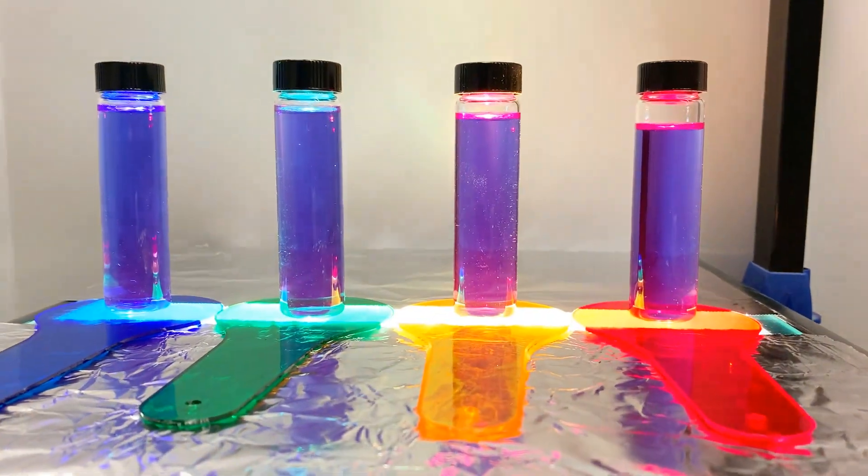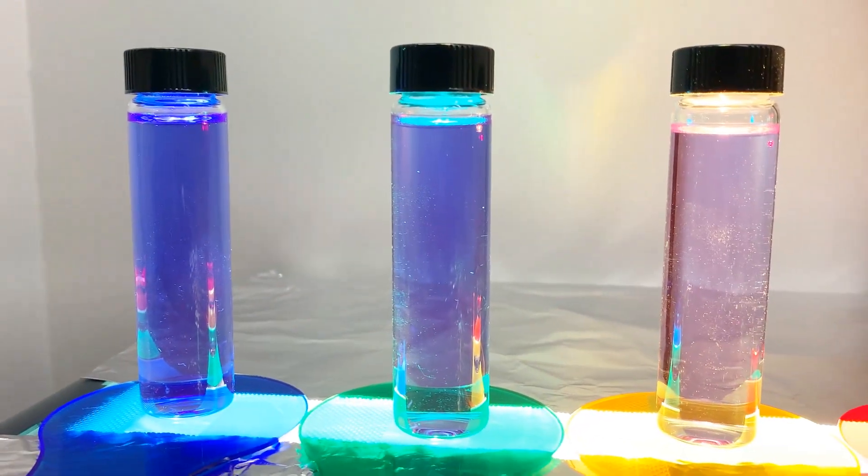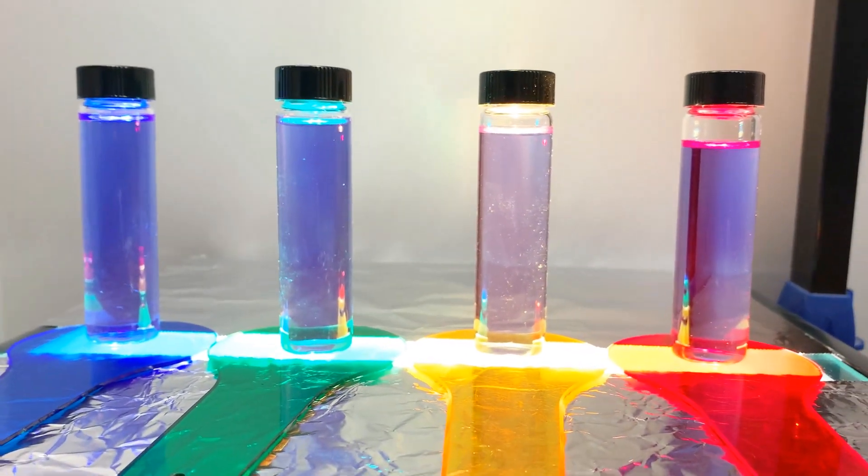Check out what happened when I turned the light on. I don't know about you, but it looks to me like the blue color is fading the most in the vial that has the yellow light shining through it.